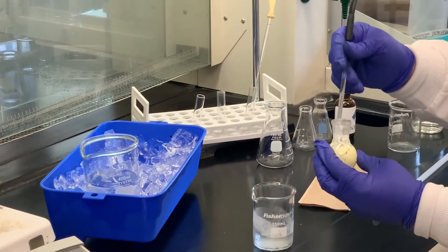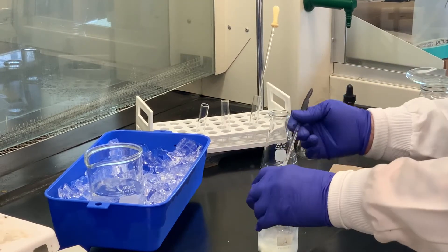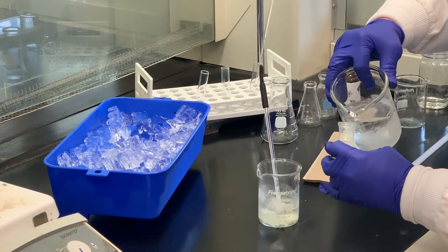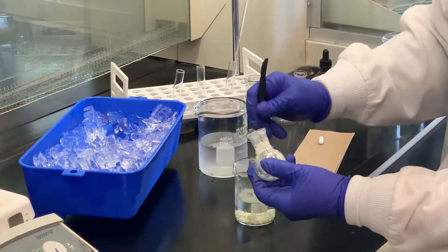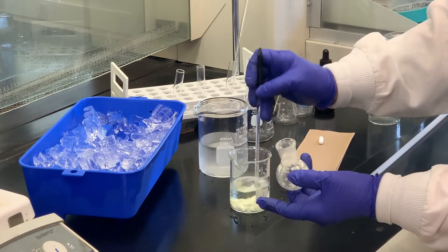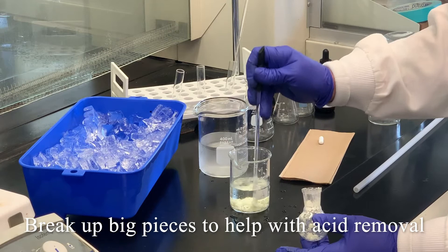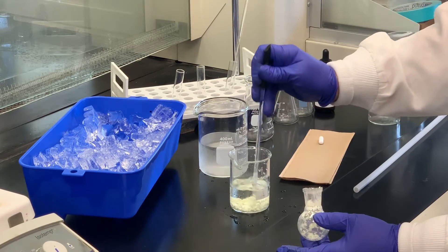I'm going to pour this in to help get rid of the acid. We're going to filter this by Büchner funnel and wash it with a lot more cold water. I'm going to use a stirring rod to break it up into smaller pieces because when we wash this, we want to get rid of as much of that acid as possible. When you have big pieces, there are always impurities — the acid — that will be trapped in there.